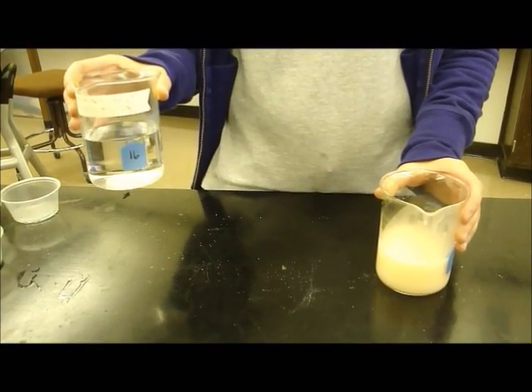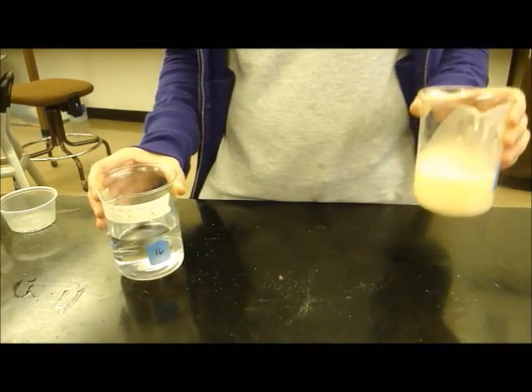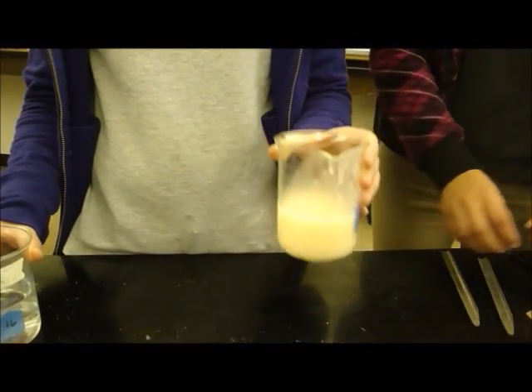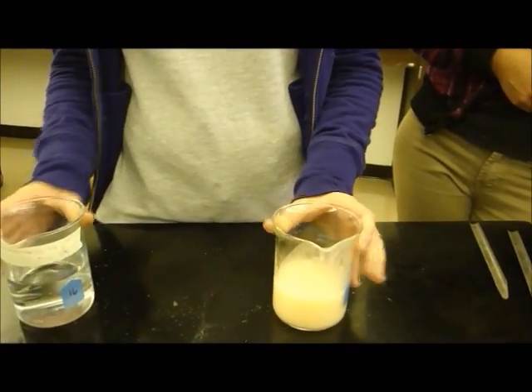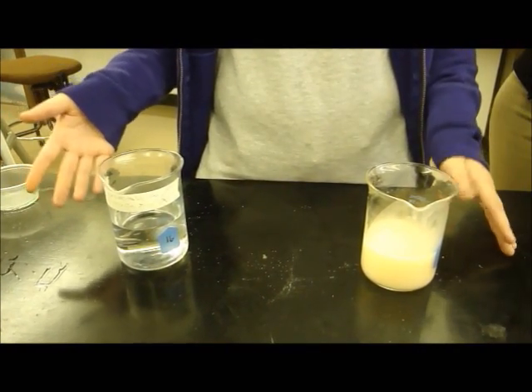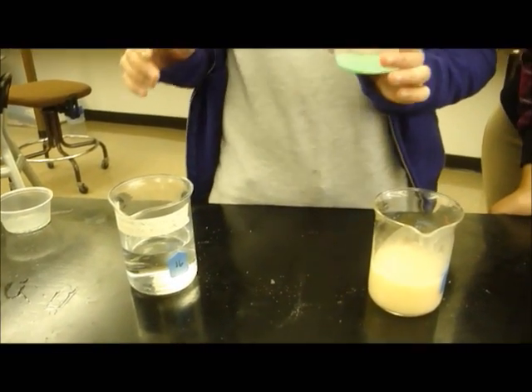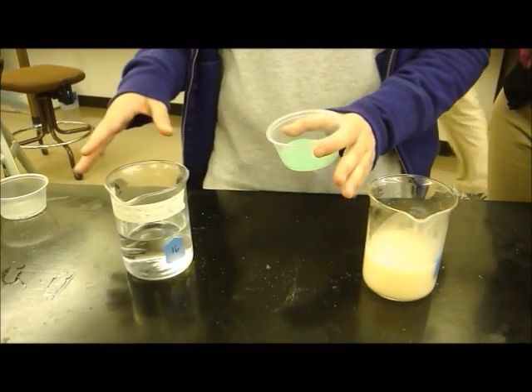In this experiment, we are testing out two different liquids. One beaker contains 250 milliliters of water, which will act as our control, and the other has 250 milliliters of liquid hand soap. 10 grams of table salt will be poured into both the water and the soap to test out the solubility of the salt in the two different liquids. The salt was dyed with green food coloring to show the contrast between the salt and liquid.